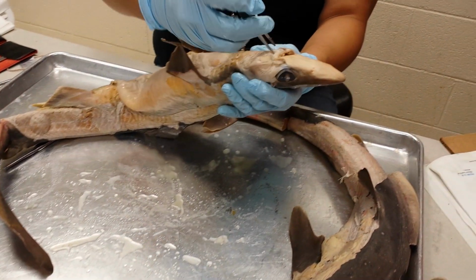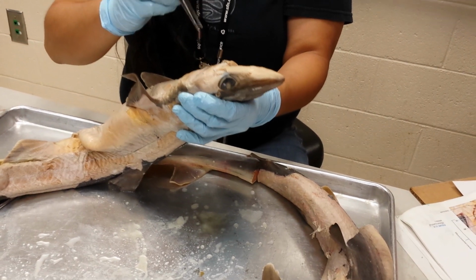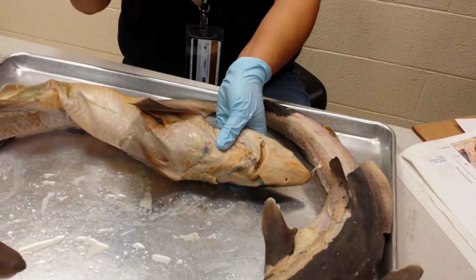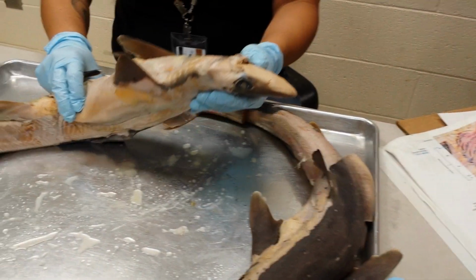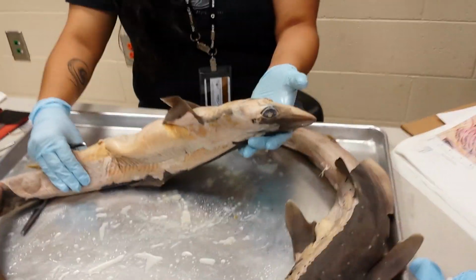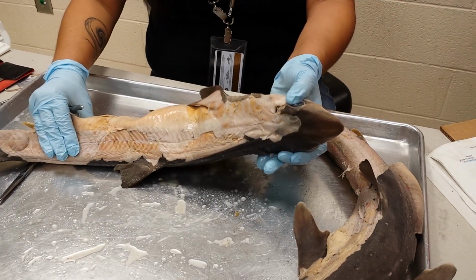The shark has teeth. It has rows of teeth, and they're sharp enough to cut your gloves. So if you feel something cold and slimy, it's because your gloves have been cut by something. And you're bleeding. It will draw blood. They're sharks. Sharp teeth.